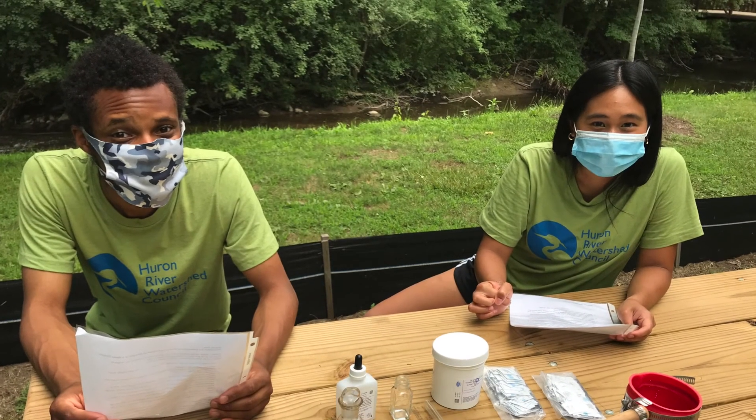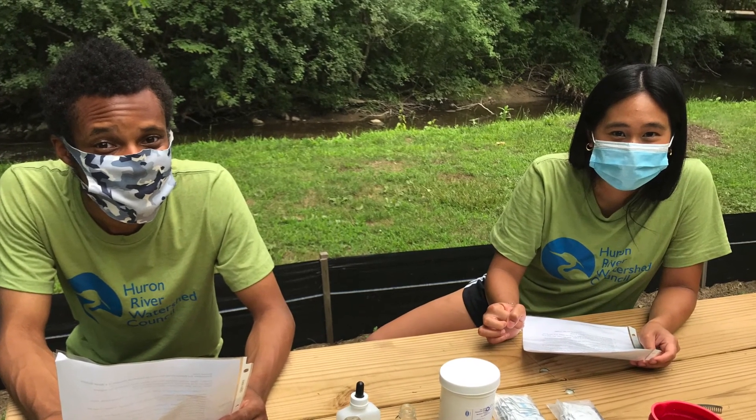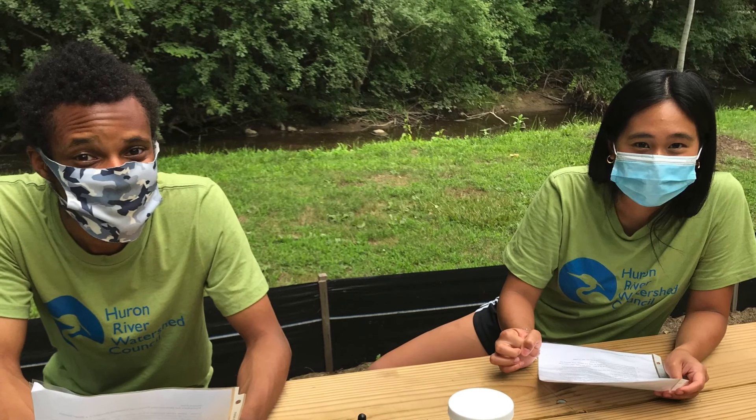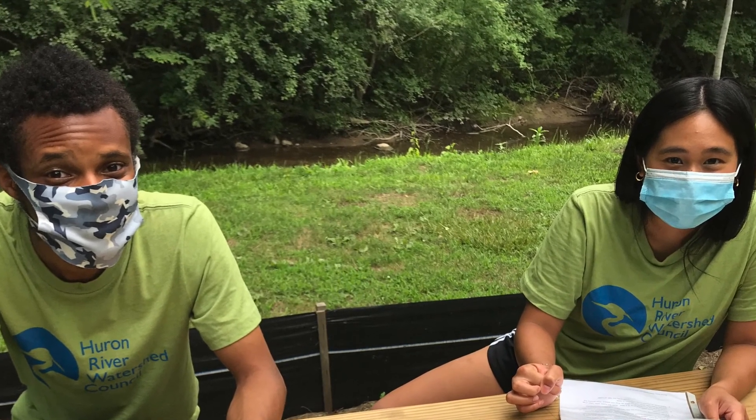The dissolved oxygen test actually takes about 30 minutes to do. We're just going to show you the process at several points.